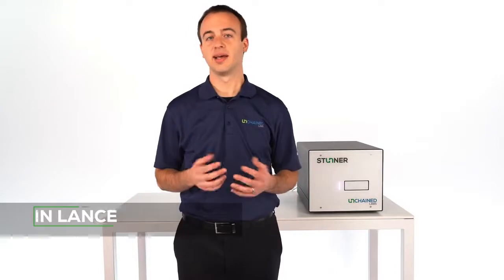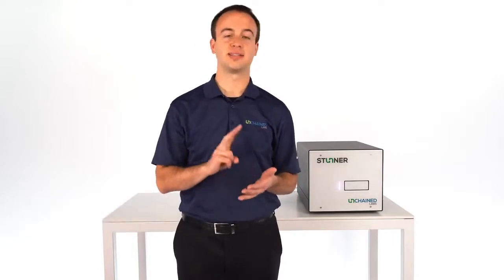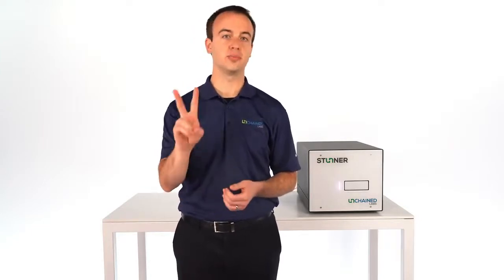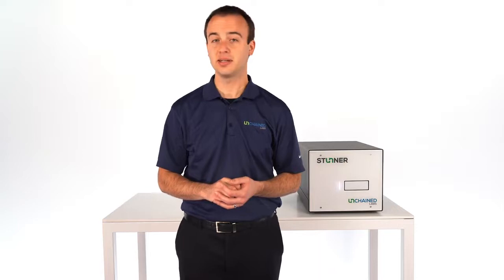In less than a minute, AAV Quant gets you label-free, standard-free, and hassle-free answers on capsid titer, empty full ratio, and aggregation with only 2 microliters of sample. Let's take a look at how it's done.